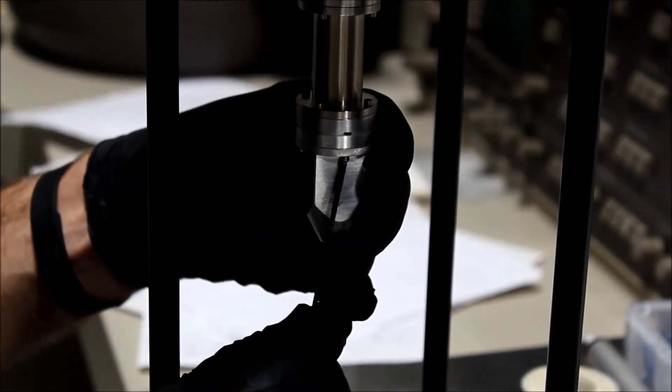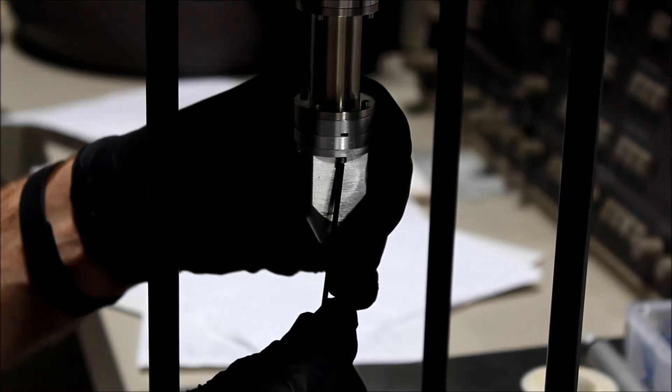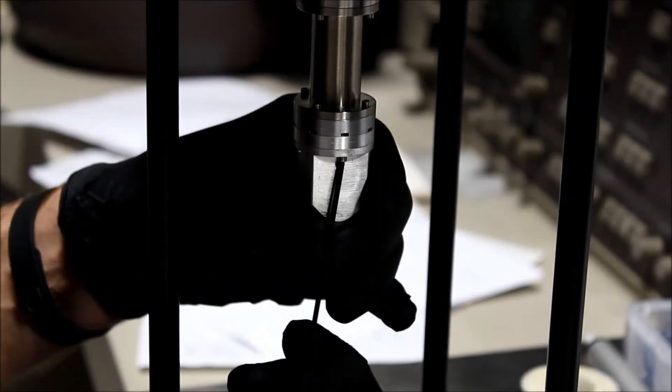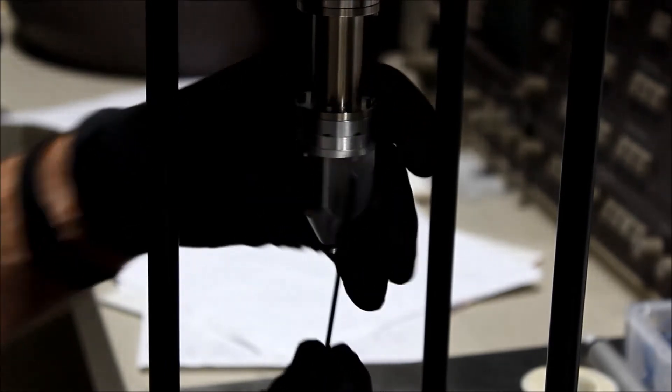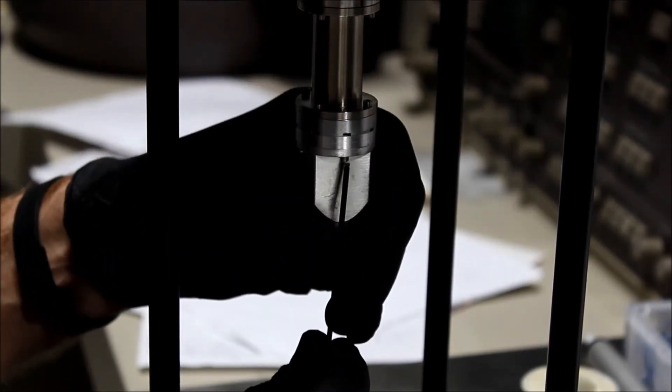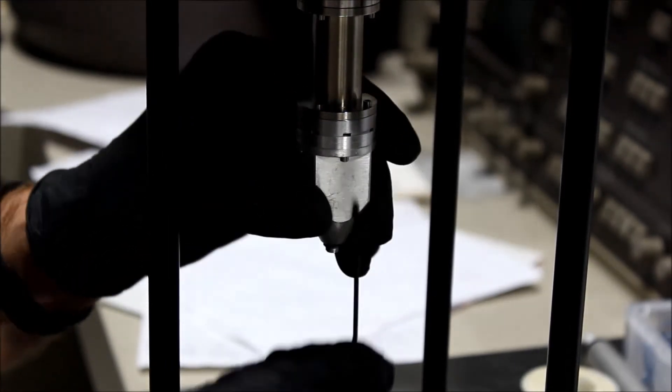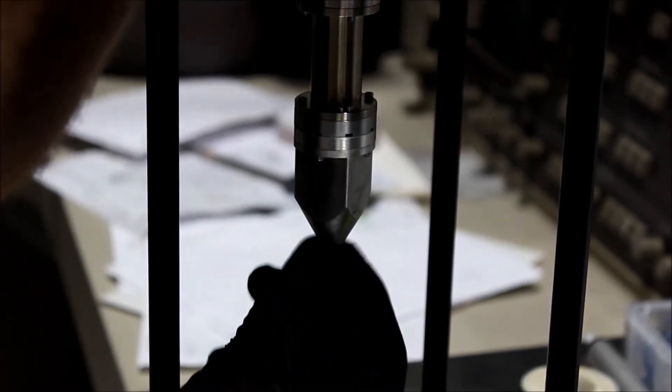These don't have to be very tight. These are very small screws and it's not worth risking stripping them out, so they just need to be just barely snug, just enough to compress the o-ring completely. Okay, so now the four 2-56 screws are tight.